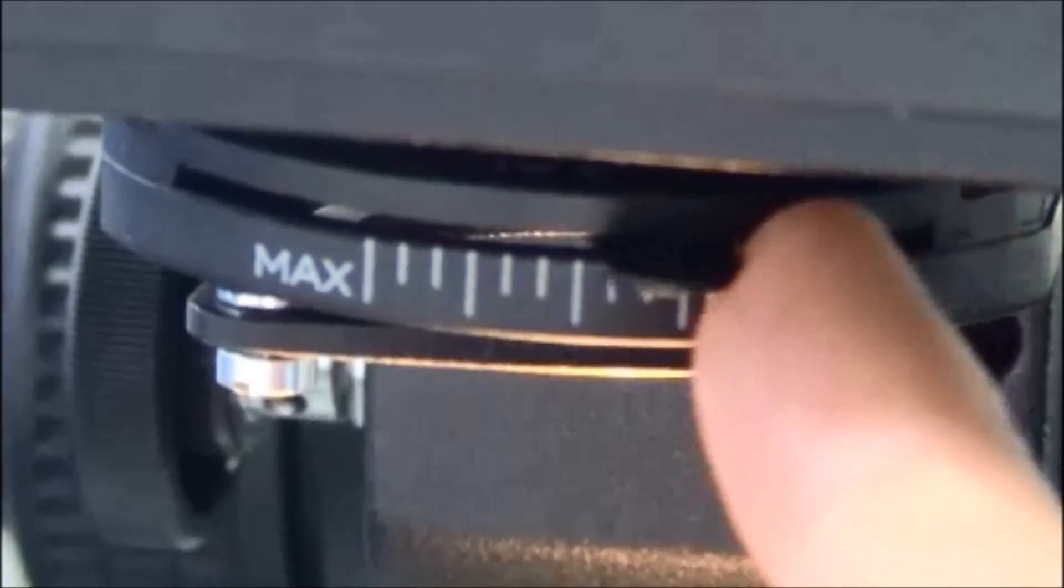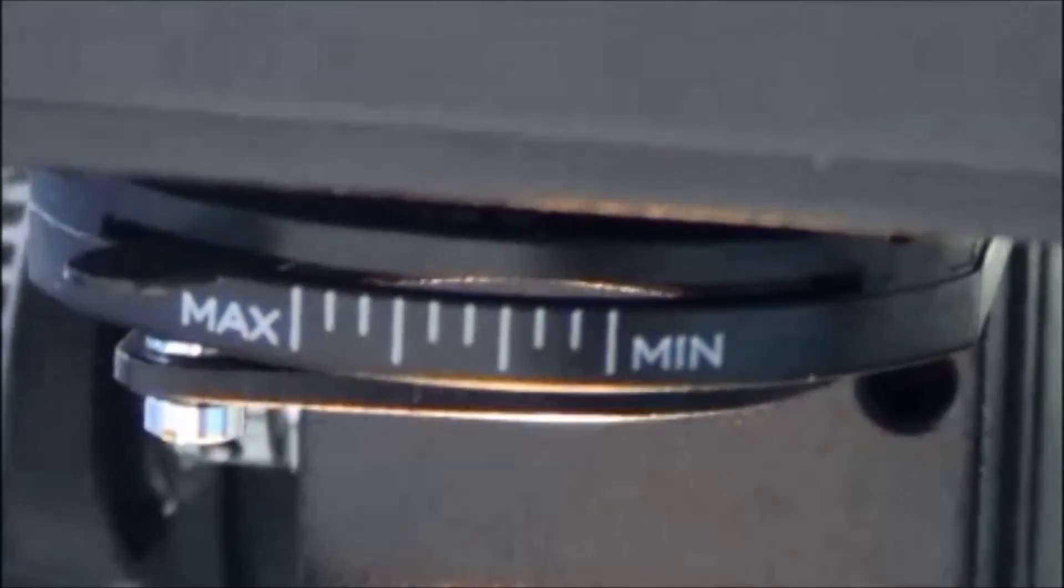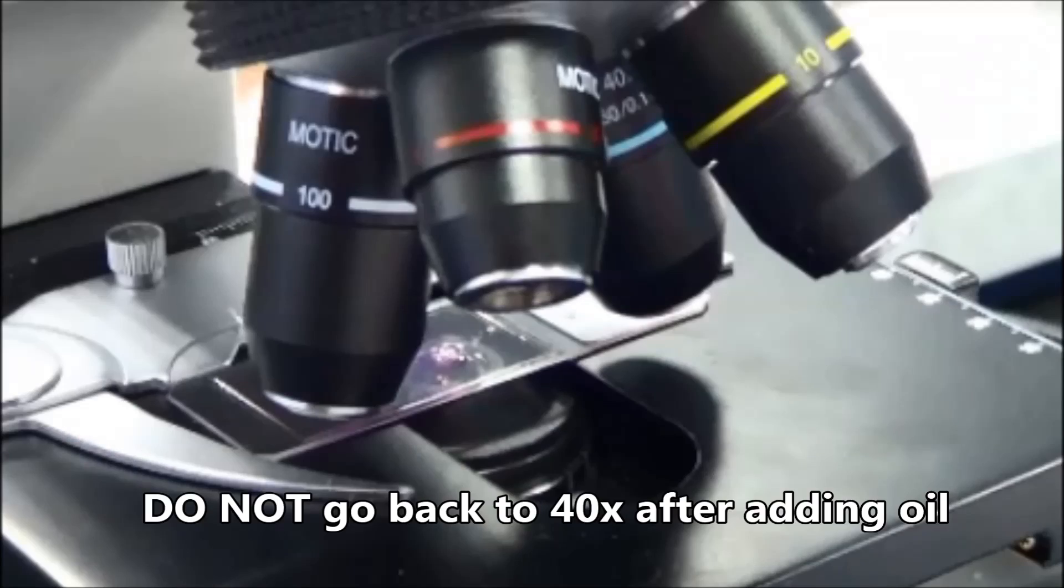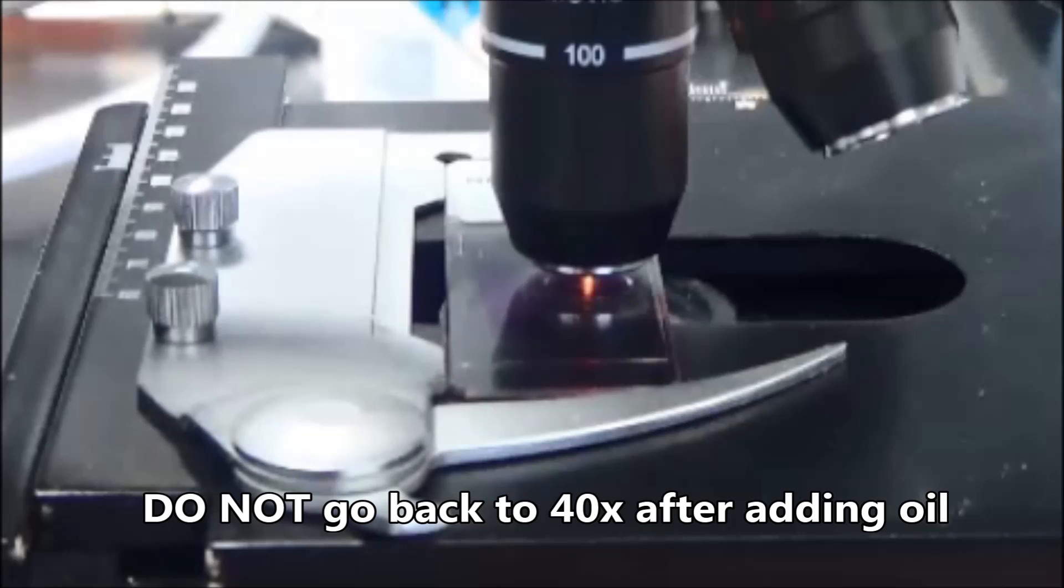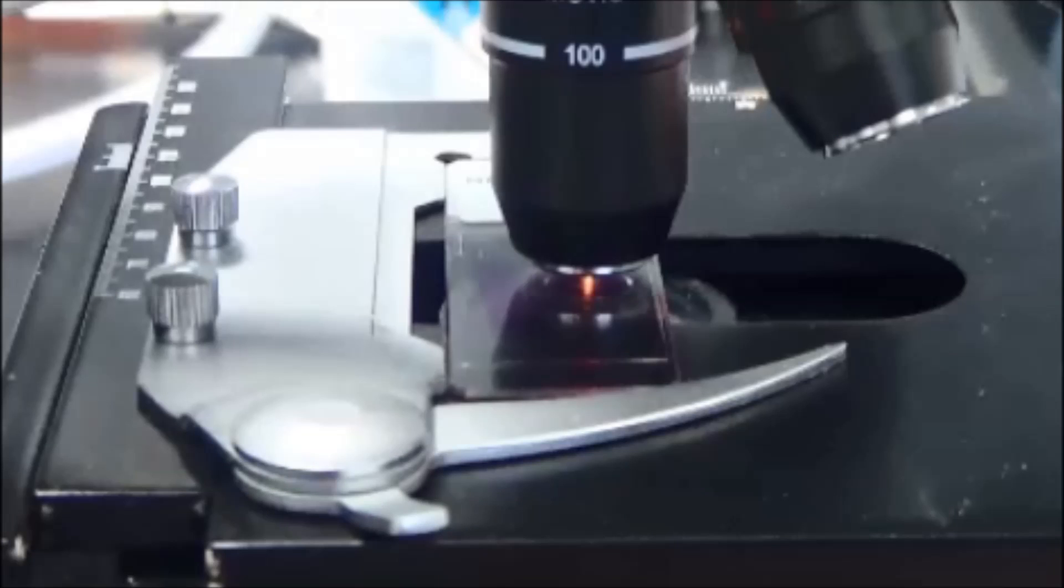Turn the condenser diaphragm towards maximum until you get the desired contrast. Under no circumstances may you go back to the 40x objective after adding oil to the slide.